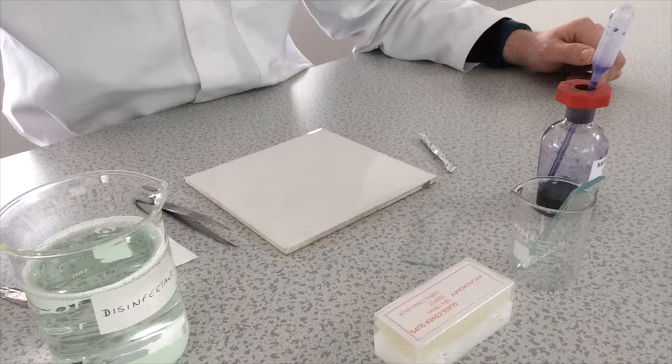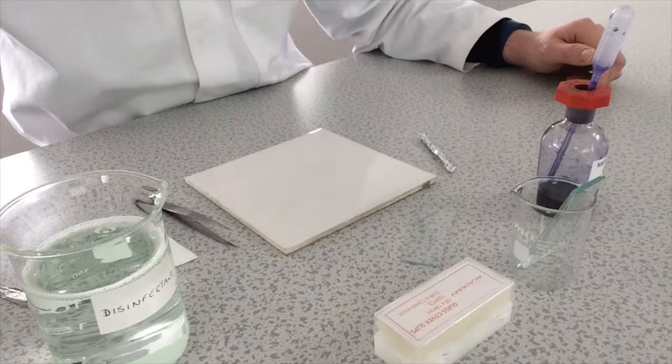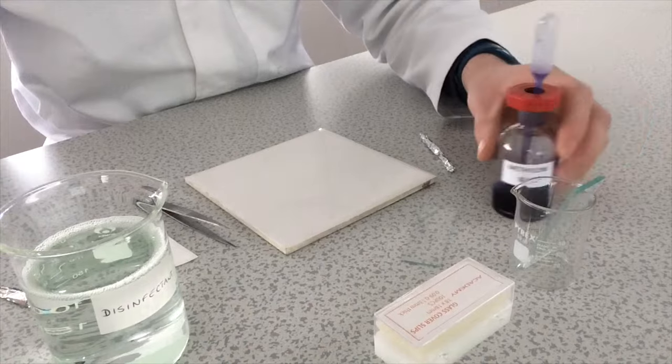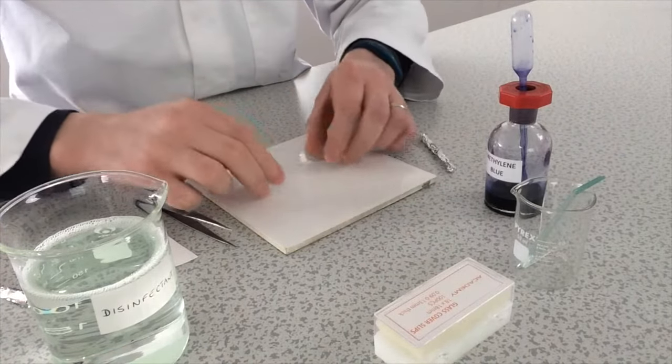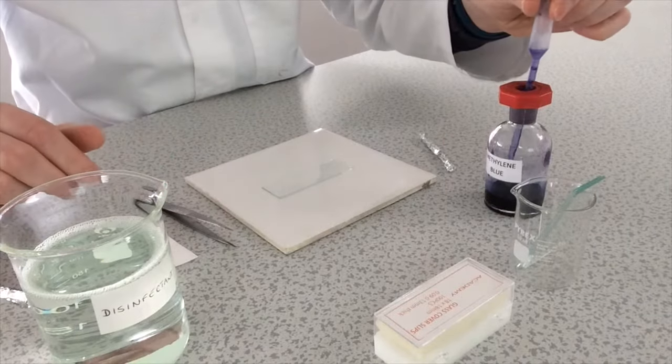To prepare your slide you begin with placing a drop of methylene blue onto your slide. I'm just going to do that on the tile.